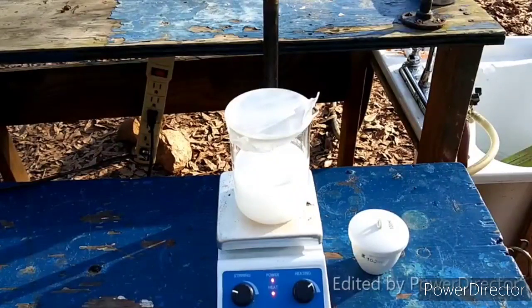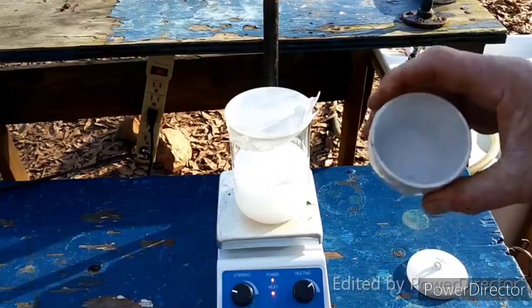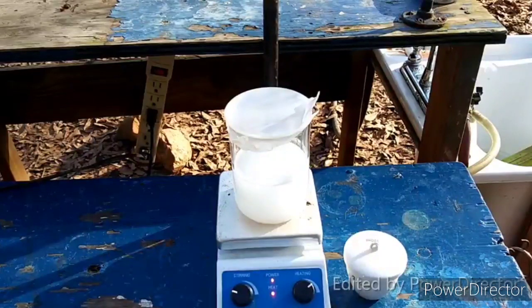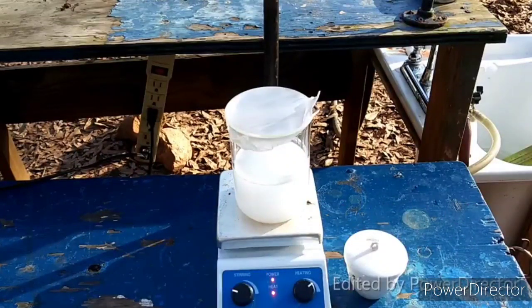Before we can explore that we need to make up the barium manganate, and I'm going to use the method exactly described in the paper. What I've got here is one molar equivalent of manganese dioxide on top of two molar equivalents of potassium hydroxide — I have it covered up so the potassium hydroxide won't absorb moisture. The barium hydroxide solution is supposed to be adjusted to a pH of seven and warm. You add a little acid to make sure any barium carbonate formed from barium hydroxide reacting with CO₂ in the distilled water and air will dissolve.